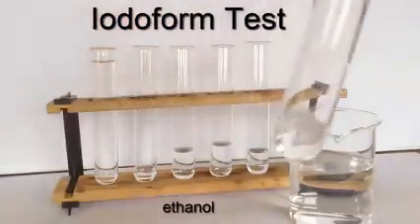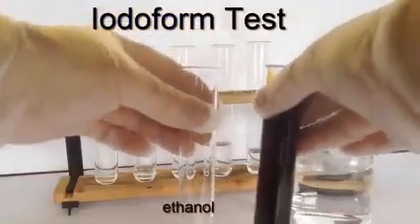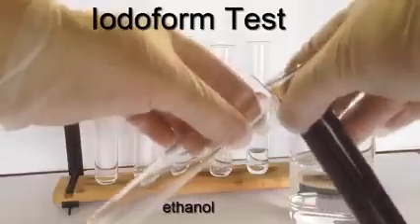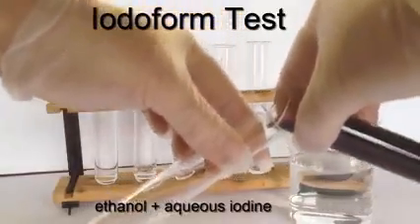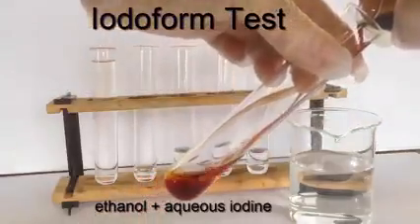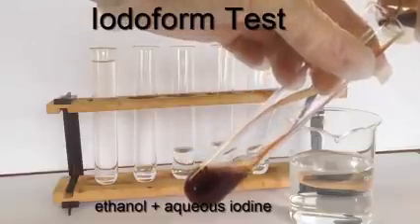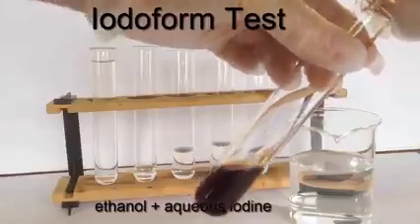Now you add approximately 1.5 times as much of the 10% iodine dissolved in potassium iodide. So I'm going to more than double the volume in the boiling tube there. If I was doing it in a test tube, I'd take probably about a cubic centimeter of the alcohol and add several drops of the 10% iodine solution.